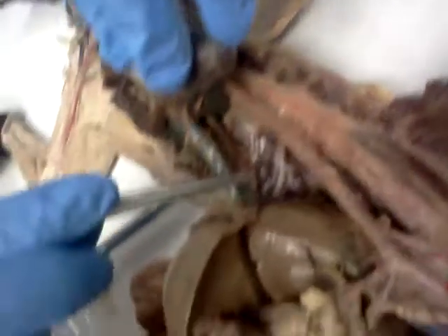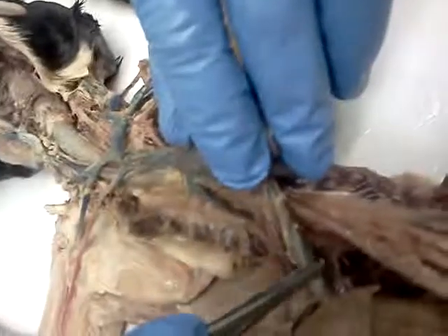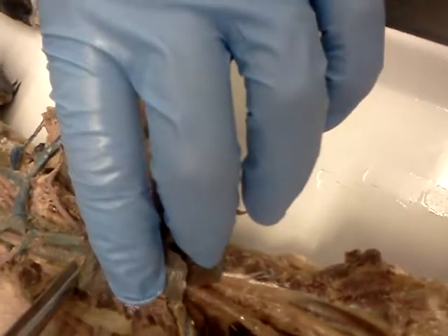So this is your inferior vena cava. It continues and travels downward. Oh, yep, forgot to point out the azygos. Thank you for reminding me. The azygos vein is right here. So don't mistake it for the inferior vena cava. The inferior vena cava is much bigger than the azygos. So the azygos comes off the esophagus, kind of? No, it kind of comes up and comes into the superior vena cava. So it comes up into the superior, and then from the superior it enters into the right atrium.